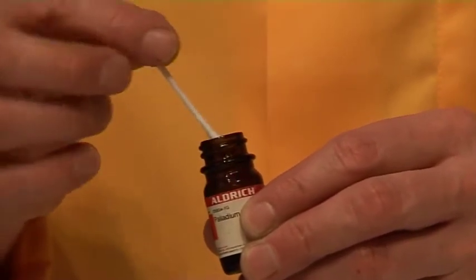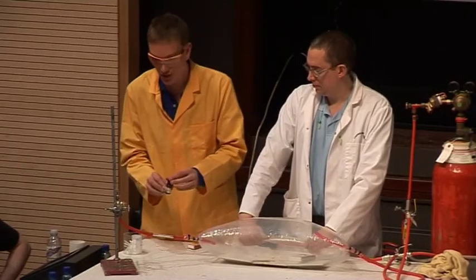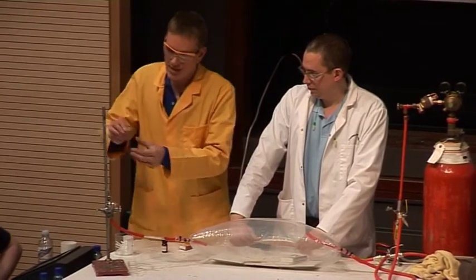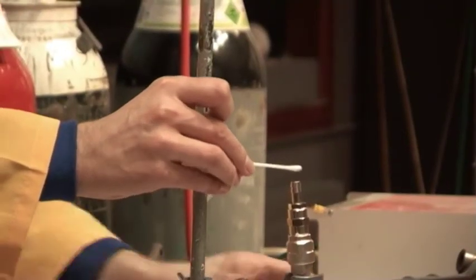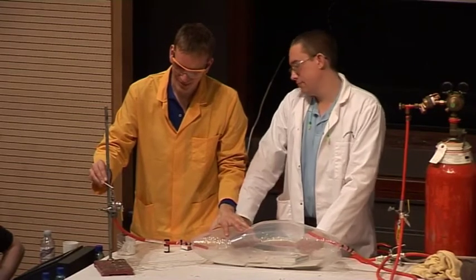I'm going to put a little bit onto this cotton bud and hold this in the jet of hydrogen. There are no flames, but I'm hoping that the hydrogen will actually light. Let's see what happens. Nothing. But keep watching. Squeeze harder, Mark.